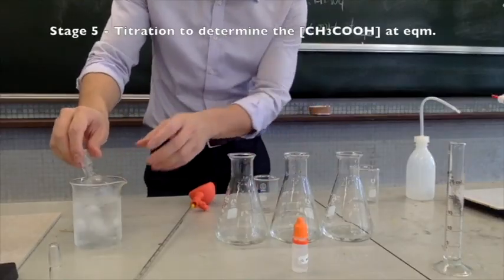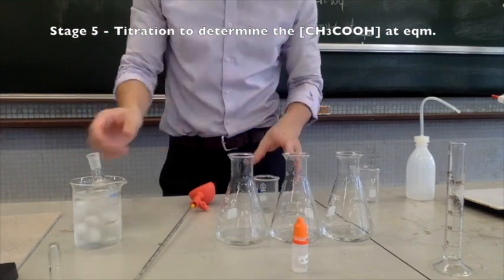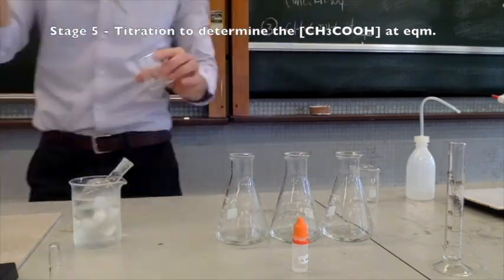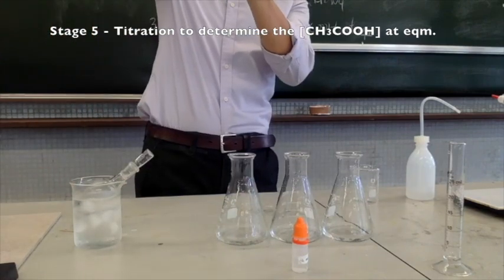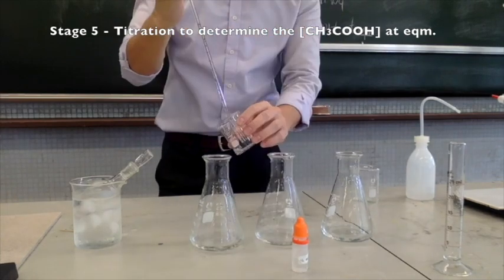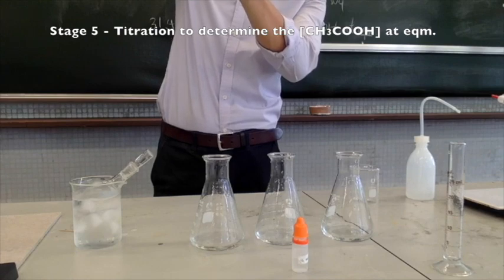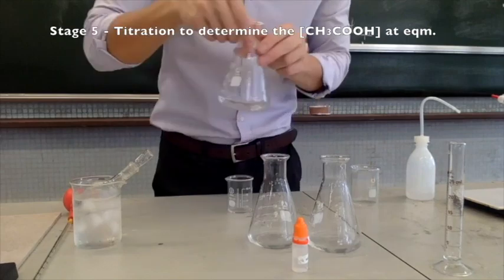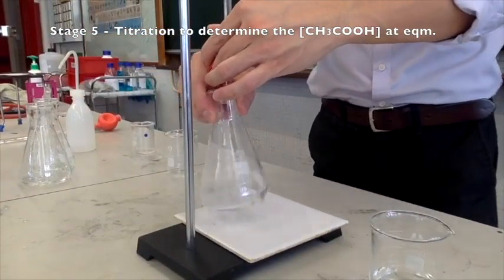And after the mixture has been cooled off, we can perform our last set of titration. This time you should expect to have a smaller titre.